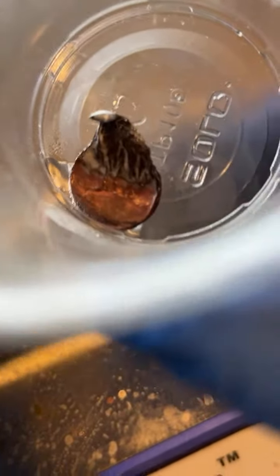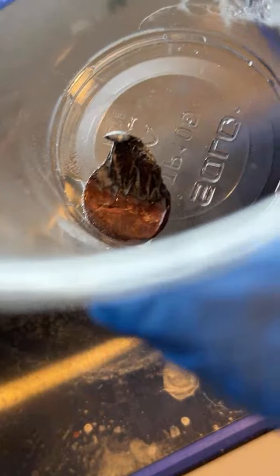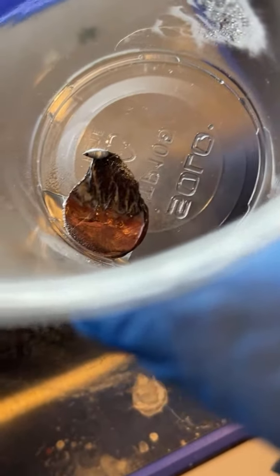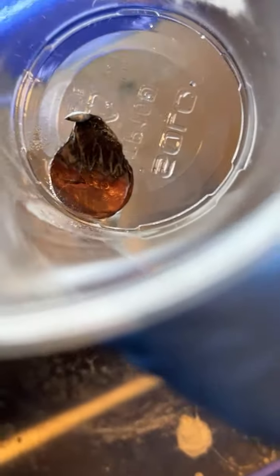And that's because zinc indeed reacts with hydrochloric acid, but copper does not. The bubbles are hydrogen gas. Hydrogen gas is odorless.